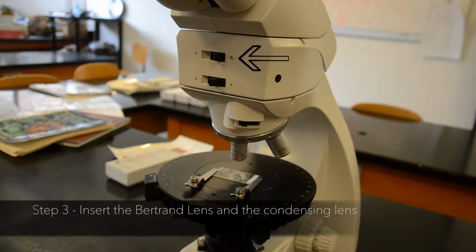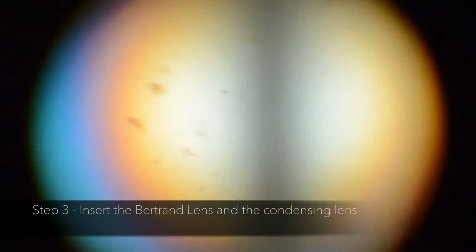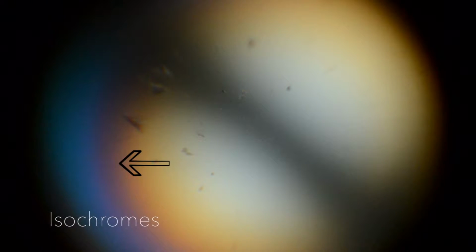Step 3. Insert the Bertrand lens and the condensing lens. For this microscope, the switch labeled BL inserts both. This is the interference figure we have obtained. The extinct arm is called an isogyre. Although we only see one isogyre in this field of view, it is important to note that all biaxial minerals have two isogyres. The interference color bands circling the isogyre are called isochromes.